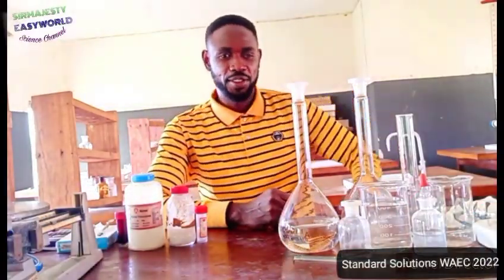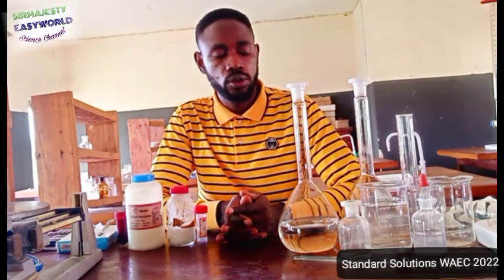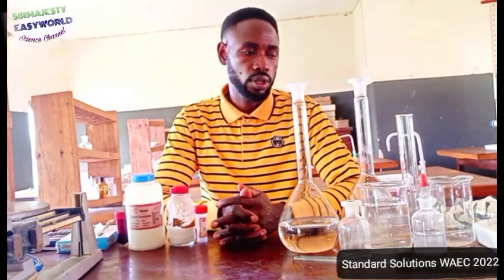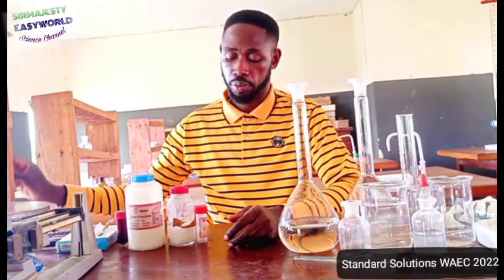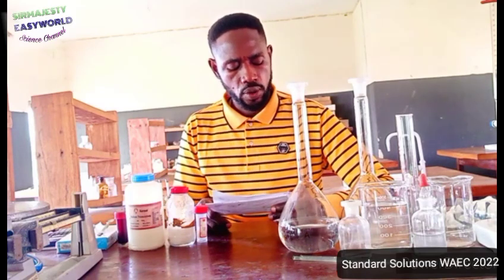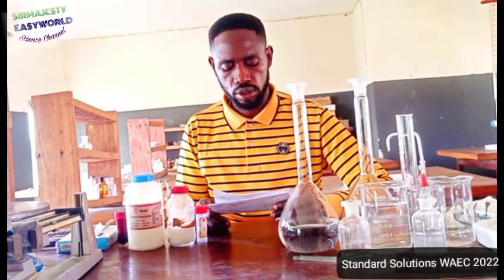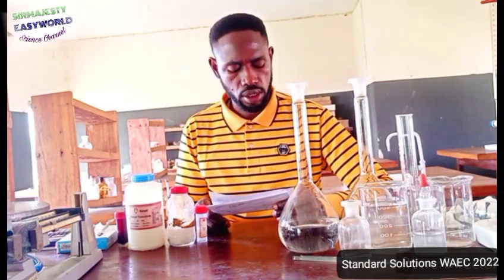Nice to see a great fellow like you. Today, I will help you prepare standard solutions according to specifications that you will see on this video. The solutions A and B, the accurate measurements, and what you are required. The solution I want us to prepare, according to the specifications by the examiner, says that 150 cm cube of iodine solution, that is for solution A, standard solution A. Look at the specifications here.